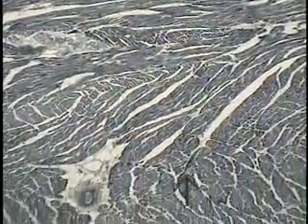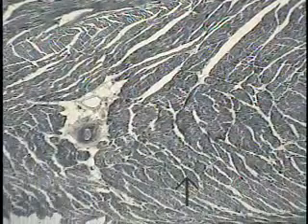Now, if one courses slowly through the muscle wall, note the arrangement of the cardiac muscle cells in various bundles or tracts or trains of cells cut in a variety of different directions, as these cardiac muscle cells and their associations form an interwoven pattern throughout the myocardial wall. Here they're cut somewhat crossways, here they're cut longitudinally, here more obliquely. This is the type of pattern one sees as one goes through the myocardium. We're still in the myocardium. You can see it is also associated with larger vessels that are supplying it, obviously.